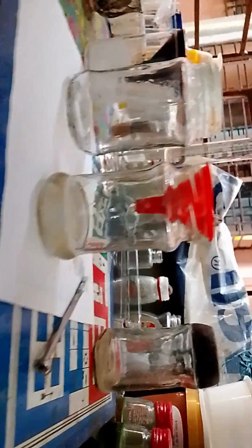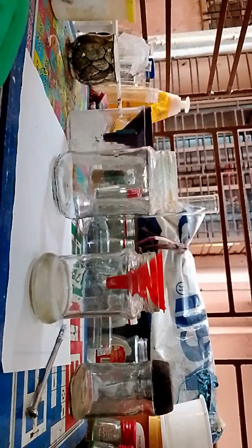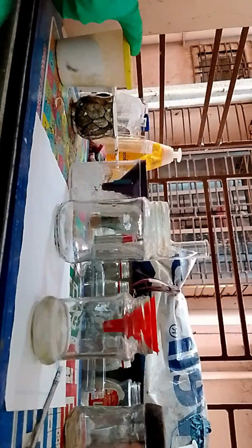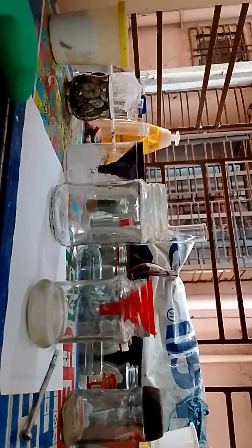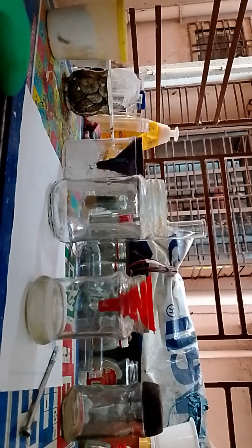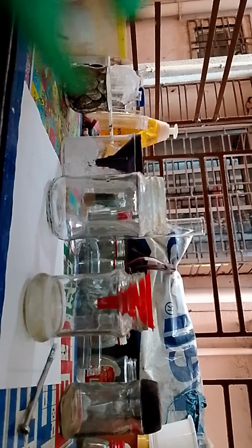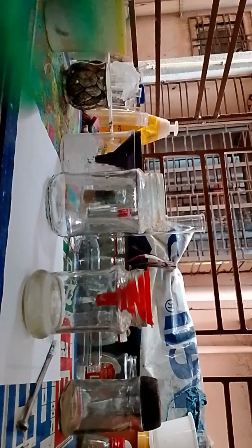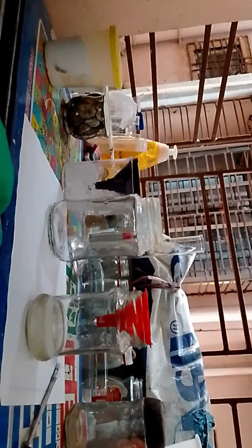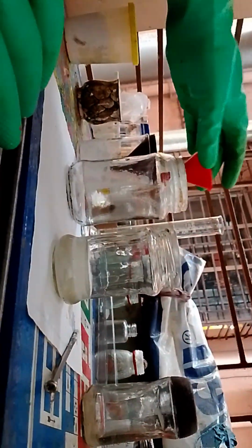Normally, this thing will not smell as much as this solid calcium chlorohypochlorite because maximum of the chlorine is dissolved in there. But we will test the pH because it is bound to bleach the pH paper to white permanently. Okay, I think the filtration is almost complete. A little shake and the filtration is complete.